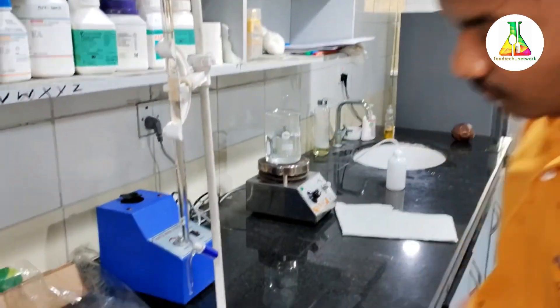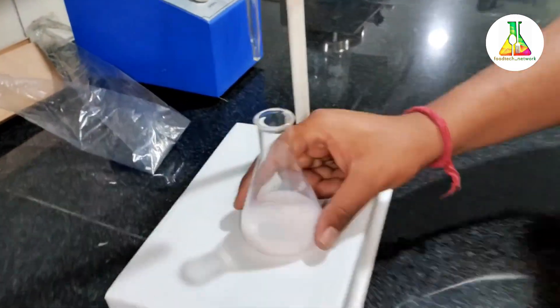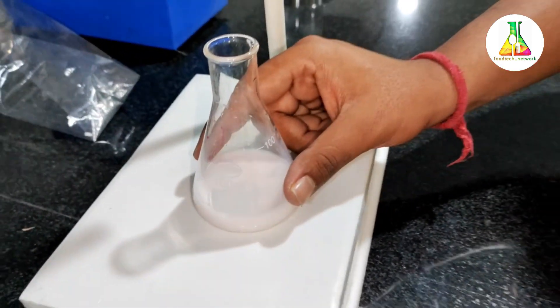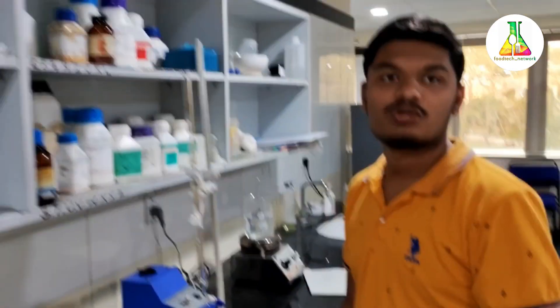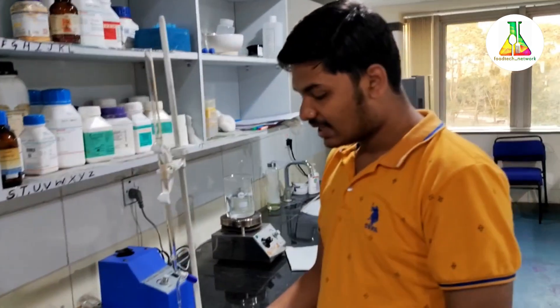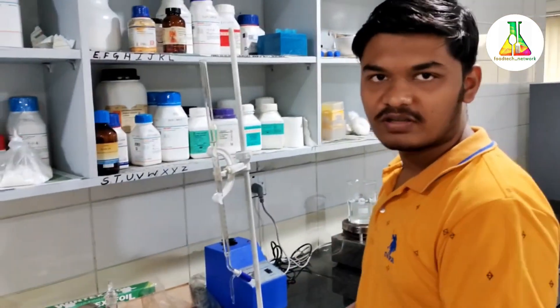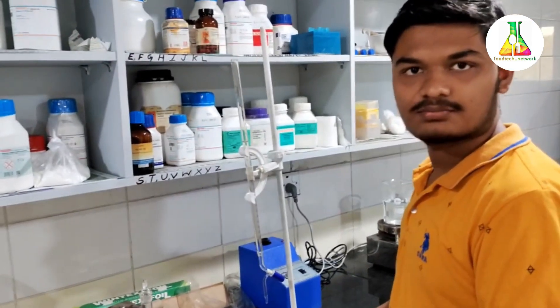You can see it has got a more intense colour, and this completes our neutralisation of the acid present in the milk. By this volume obtained in the burette, that is 5.6 ml, we would calculate the acidity. The standard range should be from 6.2 to 6.5, and the sample is slightly acidic in nature.